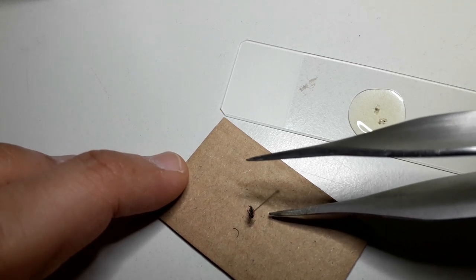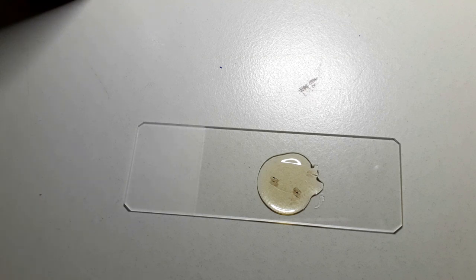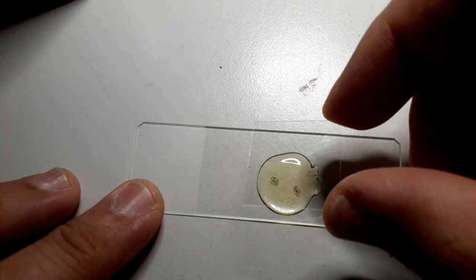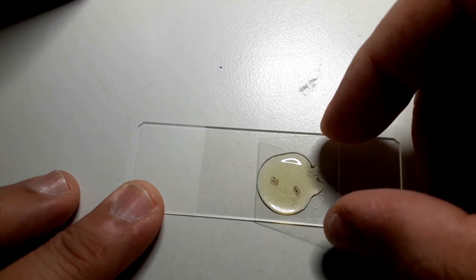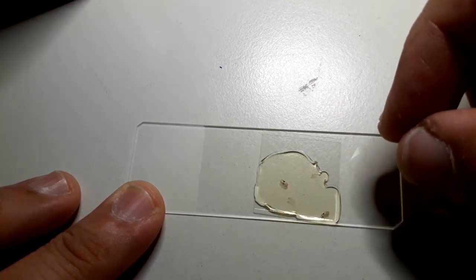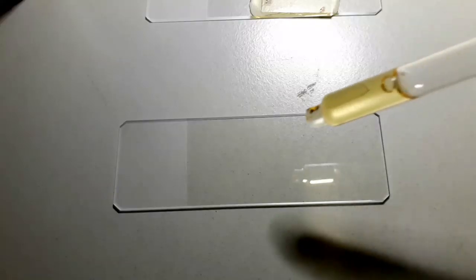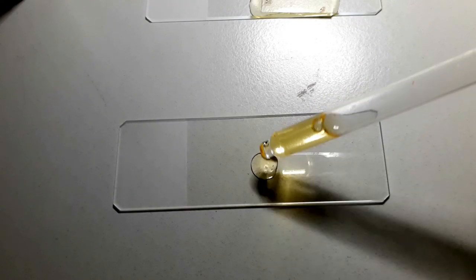On top goes a cover glass. This is now the embarrassing part because I used way too much mounting medium and it really did not look very nice. The mounting medium spilled out. Never put too much mounting medium on the slide. Sometimes less is more. Too much mounting medium means you have to wait way too long for it to dry and it doesn't look very nice.